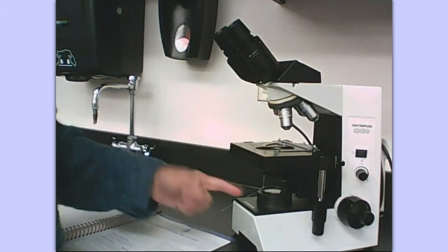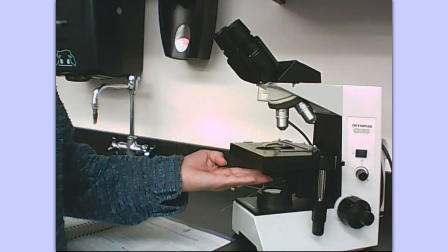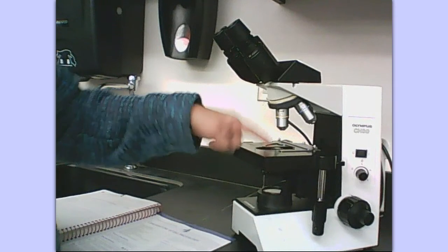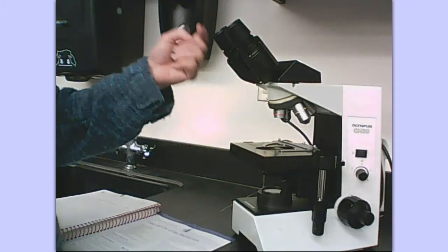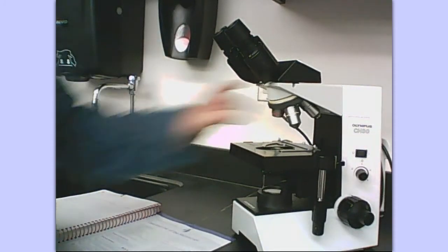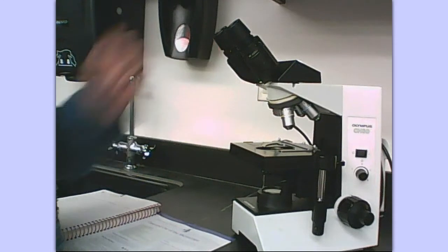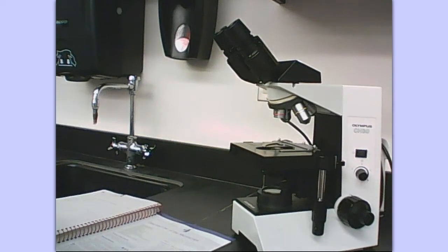Here's where the light comes from: the light source, through the diaphragm — the iris diaphragm with the iris diaphragm lever — and through the hole in the stage, through the objective, through the body tube, and to your eyes through the eyepiece. If the nosepiece is not clicked and locked into place, there's nowhere for that light to travel, so you'll just see darkness and have difficulty seeing your object.